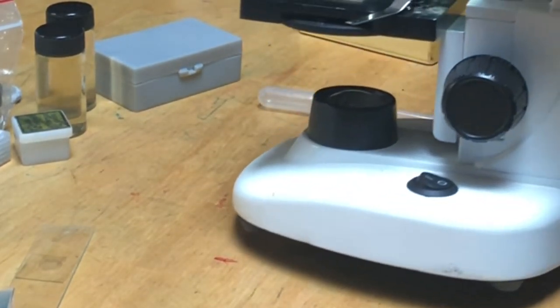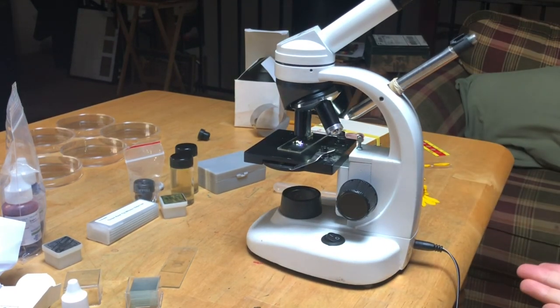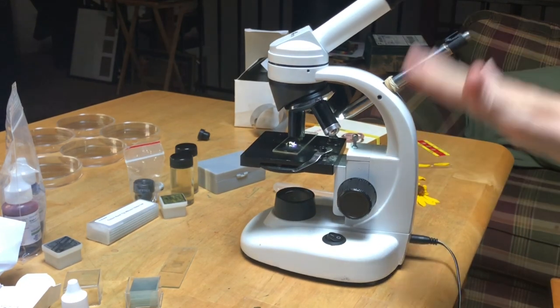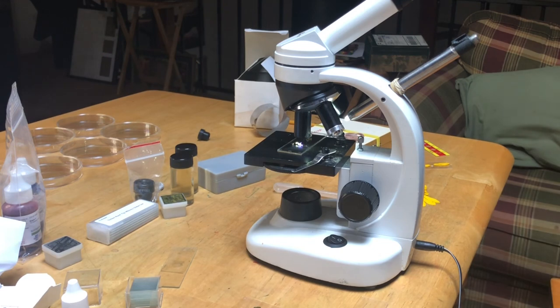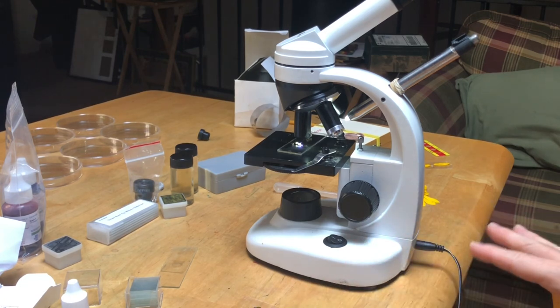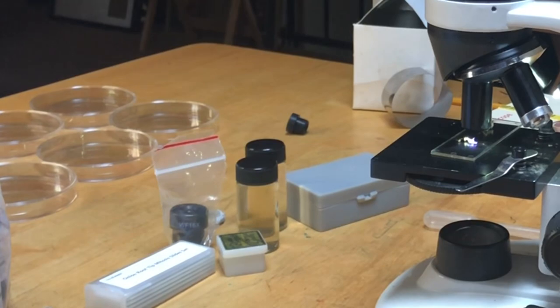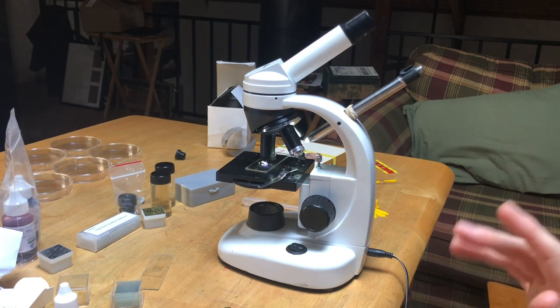And that's going to make a big difference. I'm hoping to set up my DSLR, which we will lose some magnification for that, but when I set up my DSLR I'm hoping that you will be able to see some of the things that we are viewing. So we went and collected several things: a few water samples that are over there, flowers, ferns, moss, sand, and we're just looking at different things under the microscope.